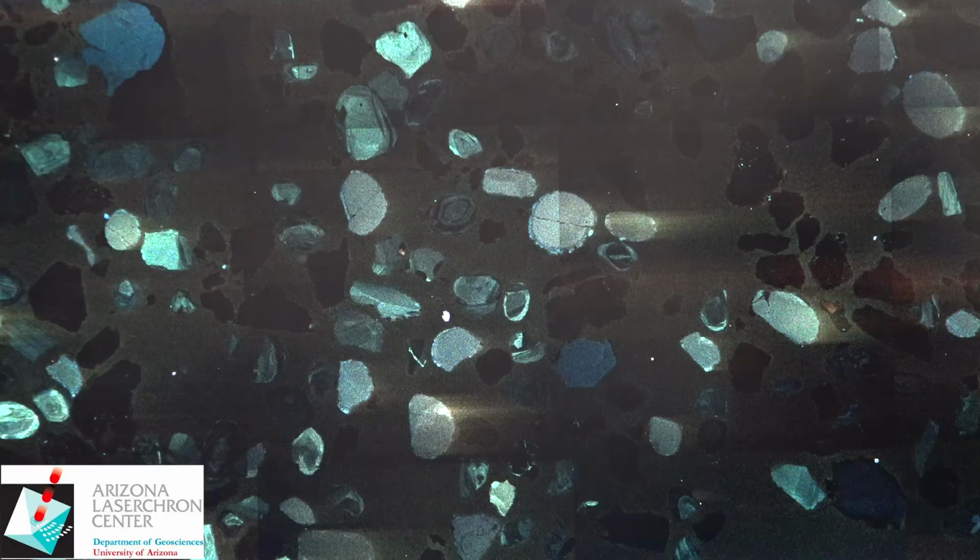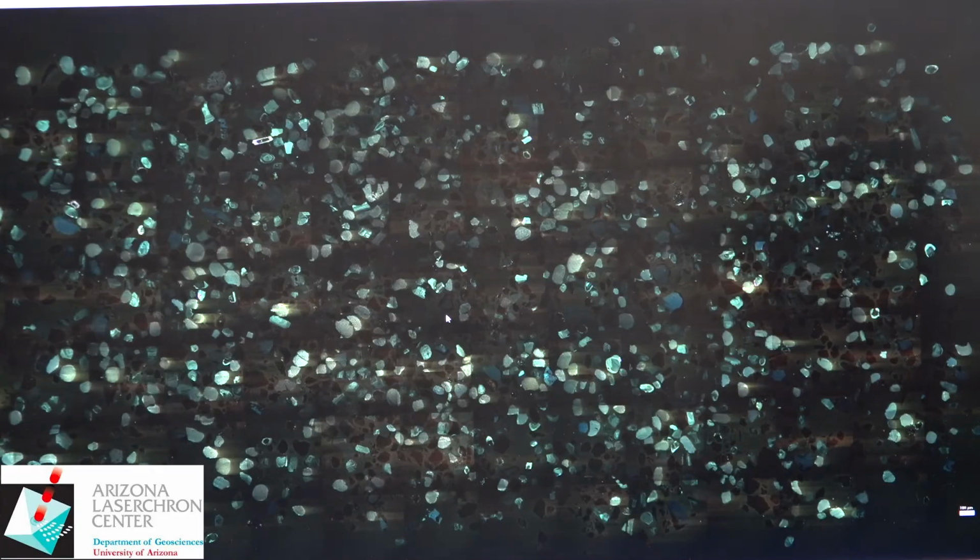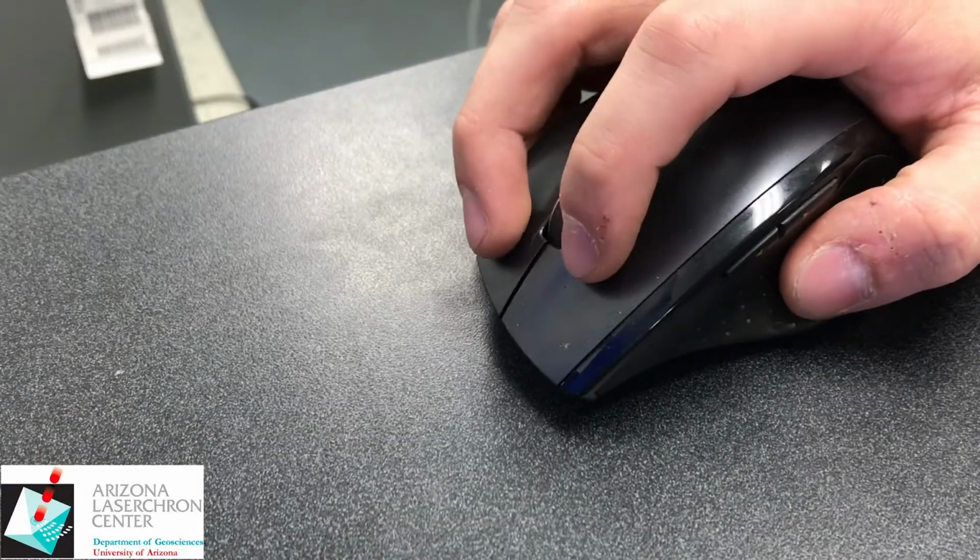The main element that causes this fluorescence in a zircon is dysprosium 3+. And there's always variations within zones and within an individual zircon or its populations in its distribution of its dysprosium. So this is the color CL that we will give you in a digital file on your Google Drive. The print-off version that we will give you is what I'm going to display next on the screen here.